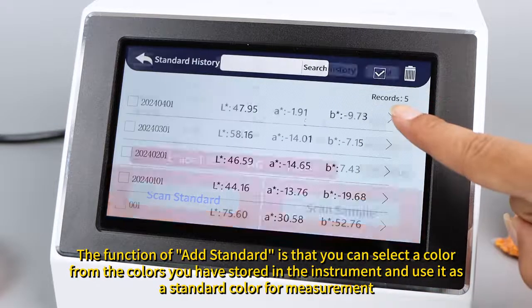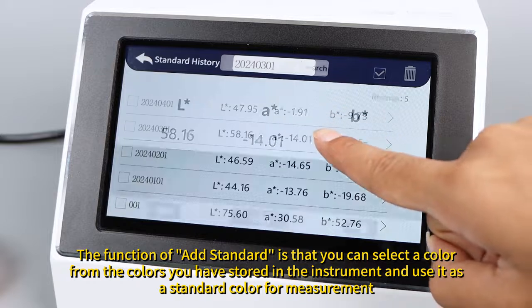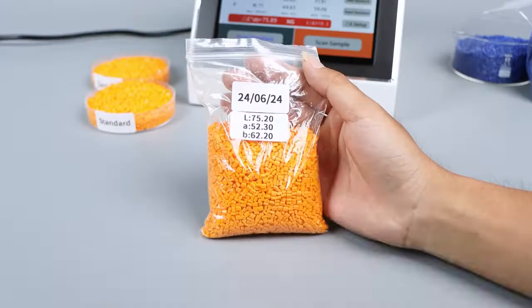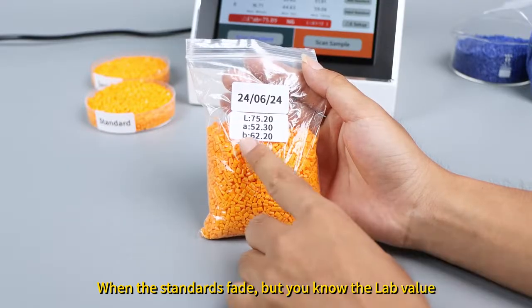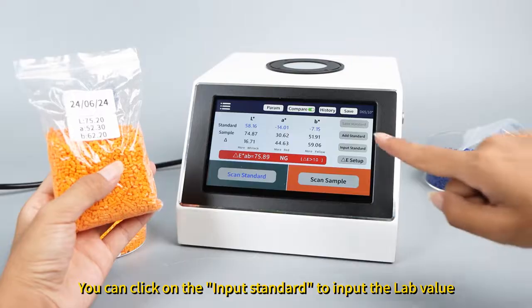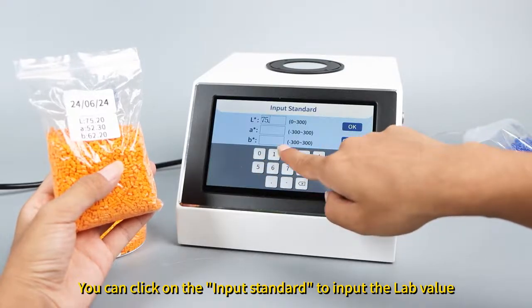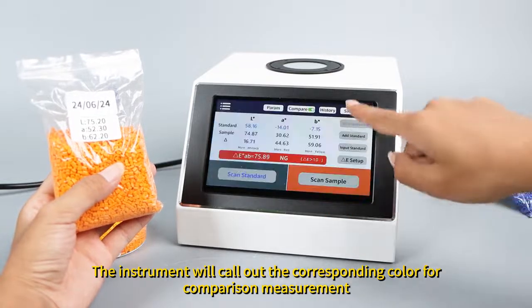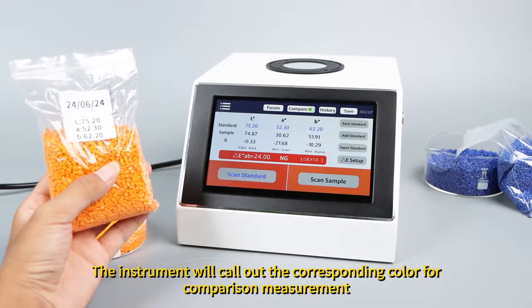The function of Add Standard is that you can select a color from the colors you have stored in the instrument and use it as a standard color for measurement, without the need to use a true sample. When the standards fade, but you know the lab value, you can click on Input Standard to input the lab value. Now enter the data for comparison. The instrument will call out the corresponding color for comparison measurement.